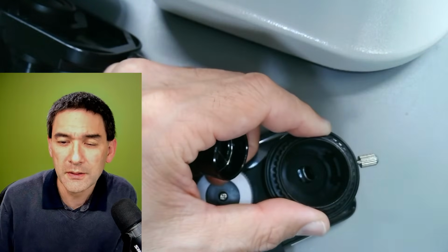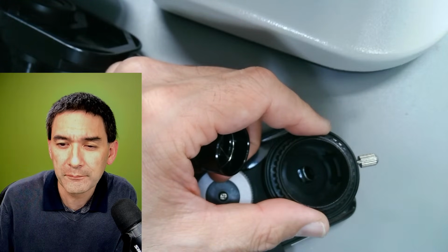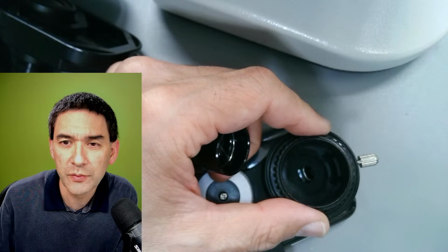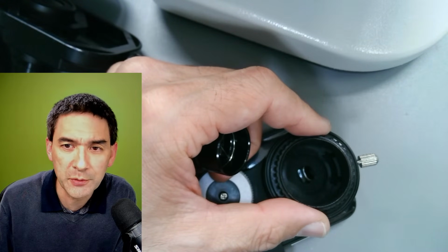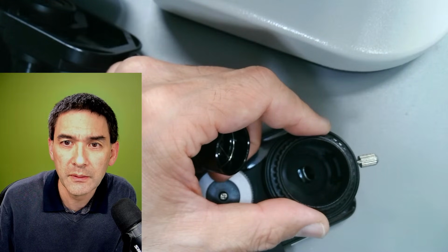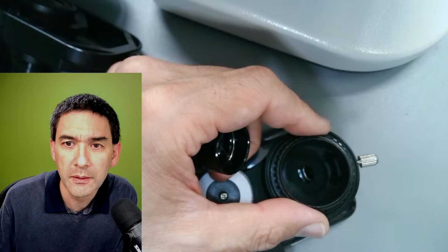So I'm quickly going through some of the comments here. Okay, and iPhone 14. Okay, I just read it. I've also got an adapter specifically made for an iPhone. I'm going to show this to you as well. I suppose new phones have better cameras though. Okay, let me quickly read this.